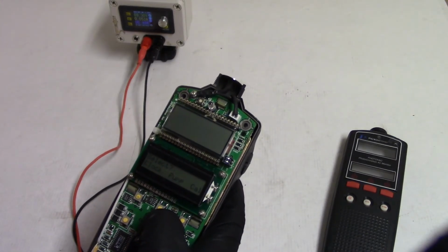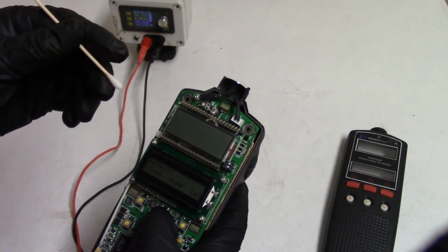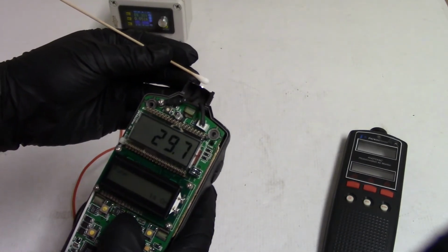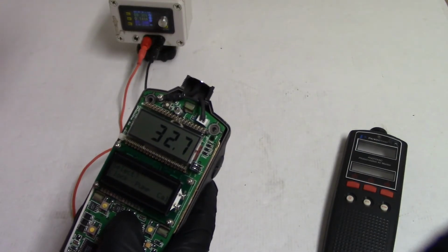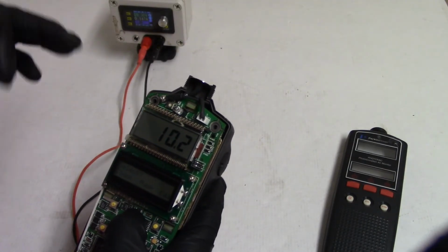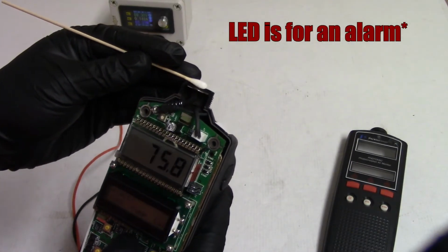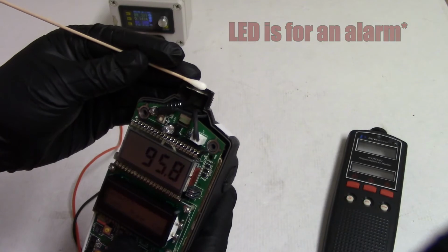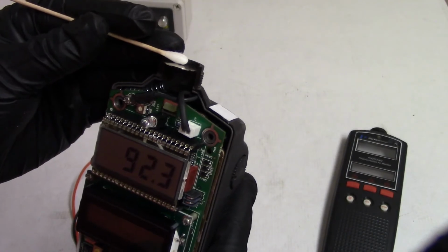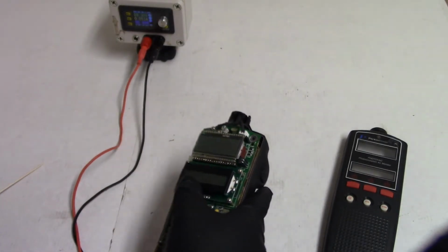So it seems like it's kind of many systems working with each other instead of one system, because it seems like the rest of the device stays on when you have it working off the pump. So it's probably always measuring. I don't know what that LED's for yet. Let's see, if we go to here, we can almost get it to go over 100. It's alright. You get the idea.